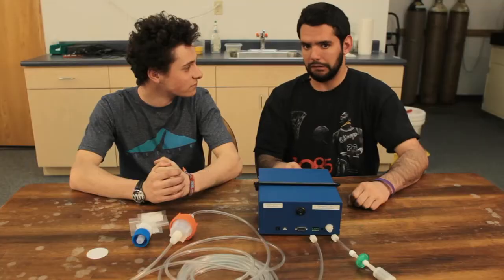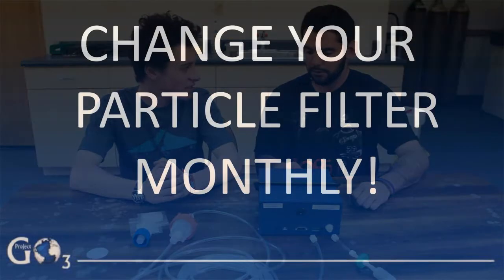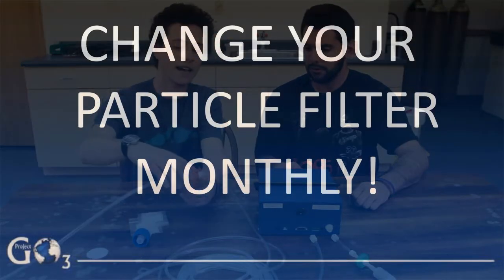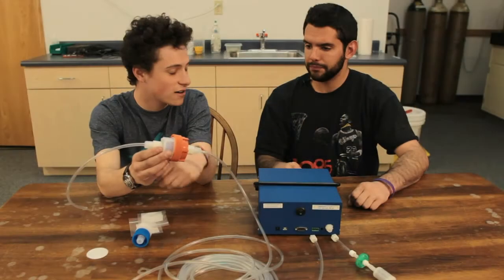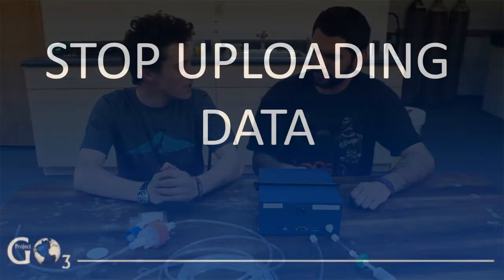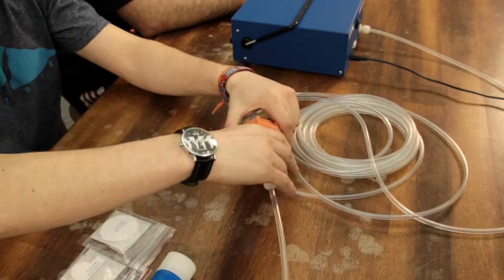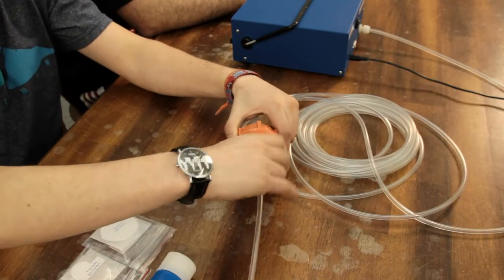Well, when's the last time you changed your particle filter? I don't even think I've ever changed a particle filter. Well, the particle filter needs to be changed monthly. It lies inside your housing. Now, before starting any maintenance, you're going to want to stop uploading data. Once you've stopped uploading data, you can start by unscrewing your housing, where you'll find your dirty particle filter.